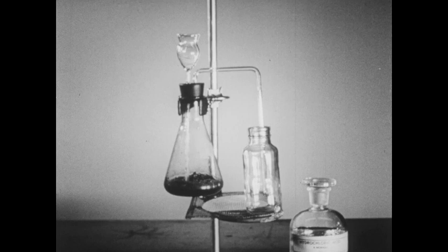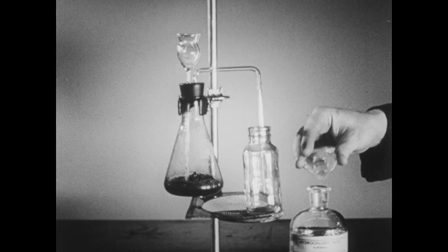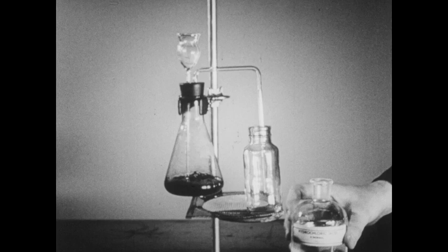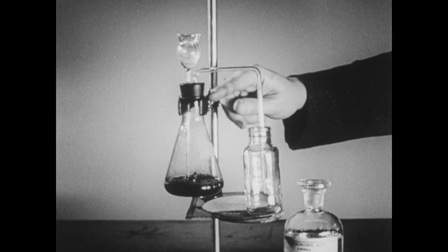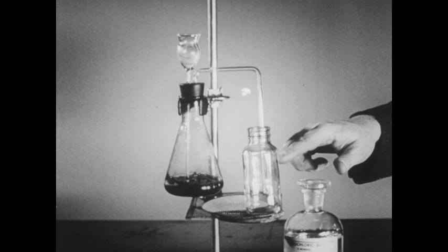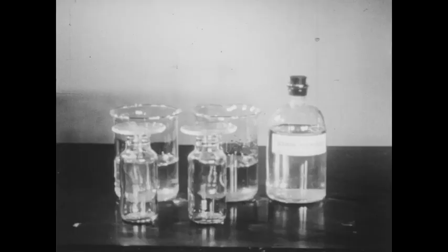In order to prepare some hydrogen sulfide for further experiments, we've set up a small generator. In the Erlenmeyer flask, I've placed some iron sulfide — ferrous sulfide. Through the thistle tube, we'll add some dilute hydrochloric acid. You can see some bubbles rising in the flask; hydrogen sulfide gas is being produced. It will pass over and be collected by the upward displacement of air, since it's slightly heavier than air. We will collect a total of three bottles in this way.